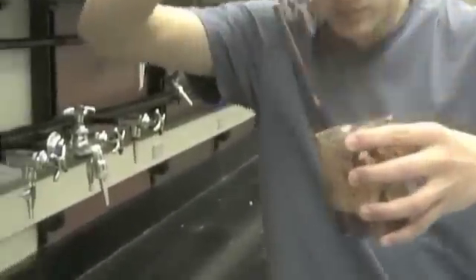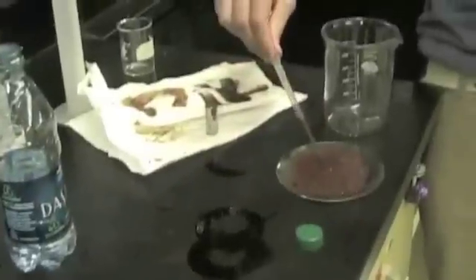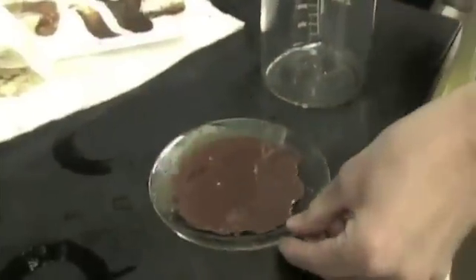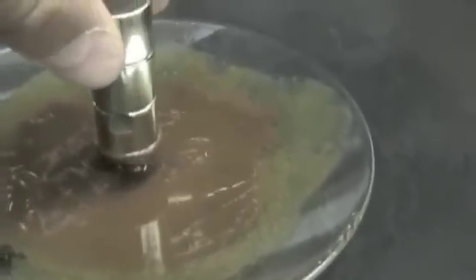John will now give us a little bit of the liquid magnet to play with, so that we can observe its properties. Notice it is magnetic — it draws it up. But because everything looks better in slow motion, let's take a gander.